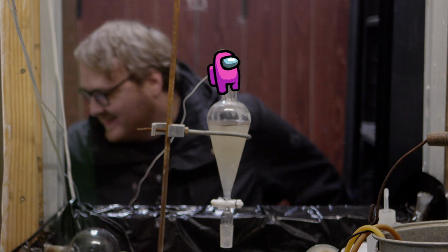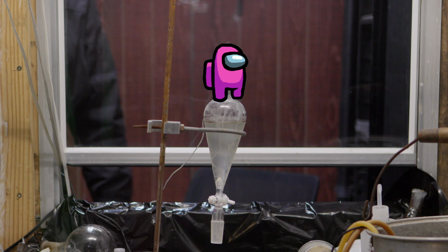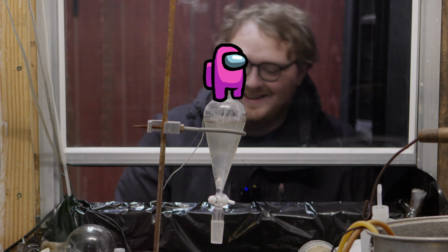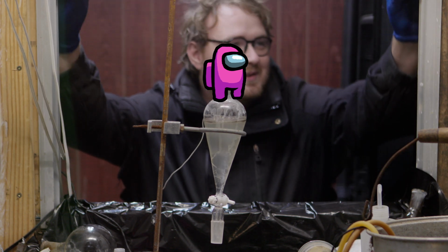Okay. If this works. Oh man. Why did that have to work? Alright, I guess that's going in the video now.